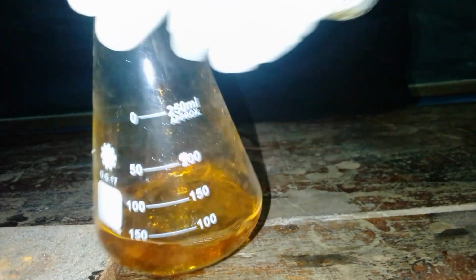Since we know that the solution will change at around 38, 39, you are not supposed to waste a lot of time. You are just supposed to release the solution until around 34, 35, or 36, 37. That's when you can slow down and be keen as far as the hydrochloric acid coming from the burette is concerned. So let us see what we are going to get after we have titrated the endpoint results.